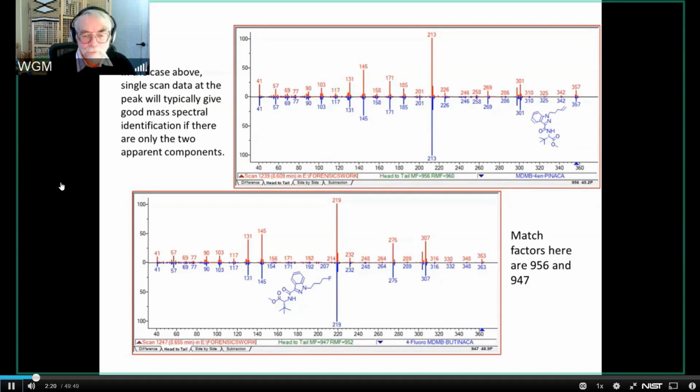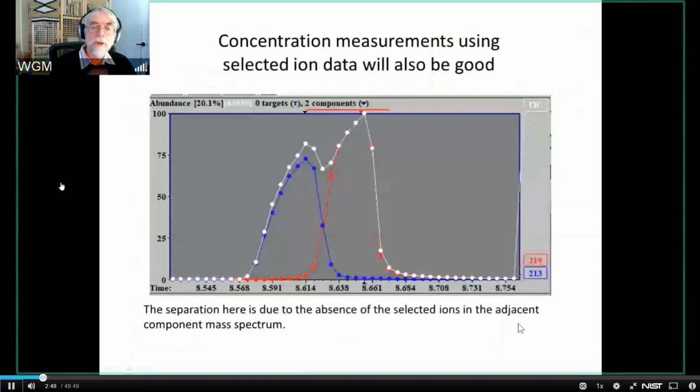But the other thing that you might often want to know in a situation like this is not just the identification, but you may actually need to quantitate the data. You may need to say, well, how much of something is there? Because there may be a threshold for whether or not it's considered illegal, or just generally you want that information. And for these kinds of data, you're still in pretty good shape. So for concentration measurements, I'm using selected ion data. In this particular case, I'm using the base peak, which isn't necessarily always what you want to do. But this is the base peak of those two spectra. And you see that there's almost no interference in the base peak.